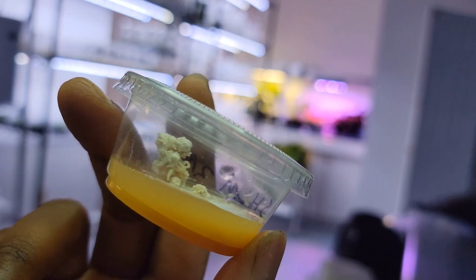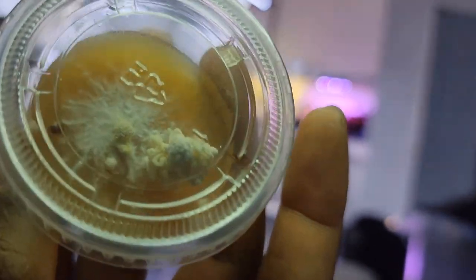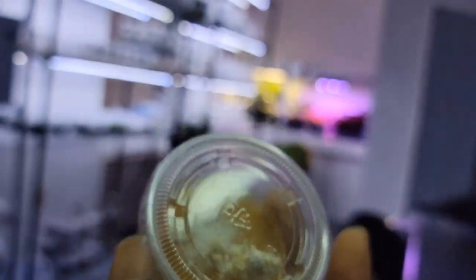It's been growing out for a while. There was a lot of bacteria on it because I caught it when it was kind of rotting, so it took a lot of isolations. But I think we're on the final isolation now and we're going to do that final isolation today. Hopefully get that cleaned and then grow it out and start eating it again.